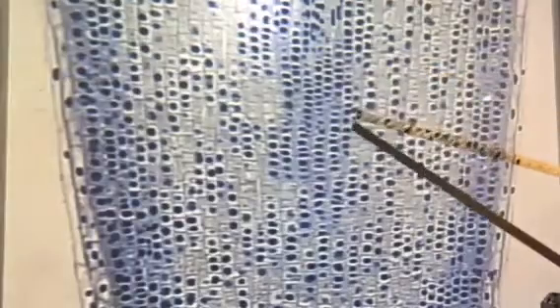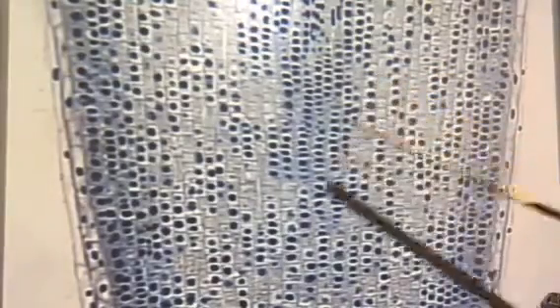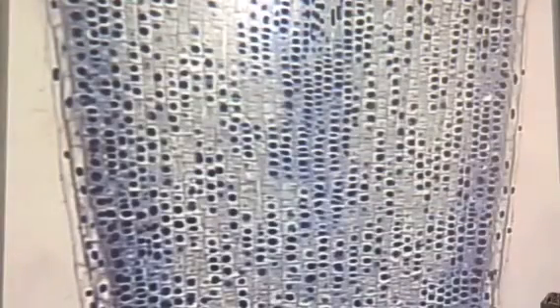I'm starting to see my cell walls. Those are all the lines going every which way. Those are all cell walls, and then the really dark stained blue things here, those are all nuclei. When we go up to high power here, we're going to start to see what's going on in the nuclei, because that's going to give us our clues for what stage of mitosis we're in.